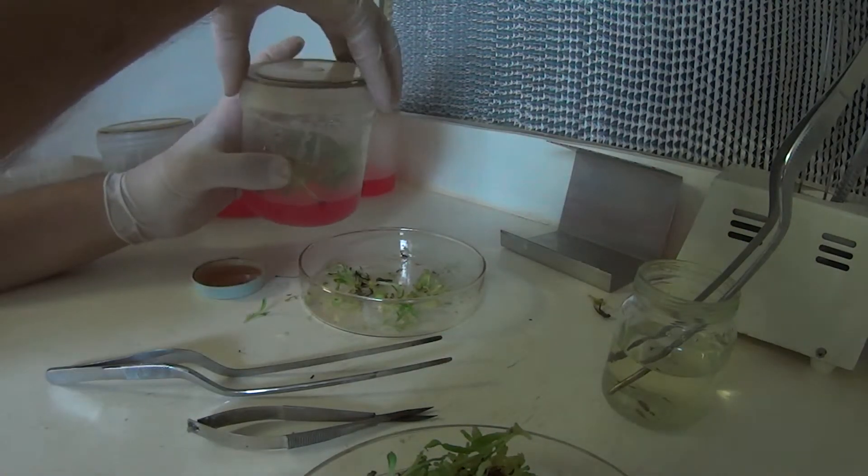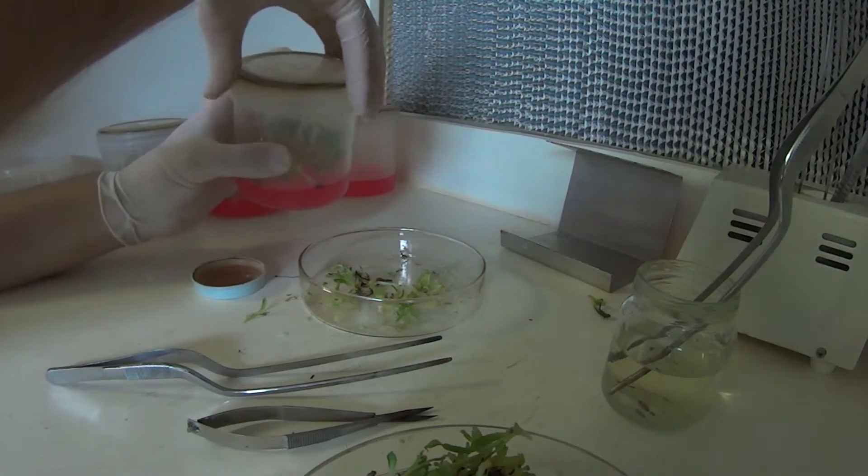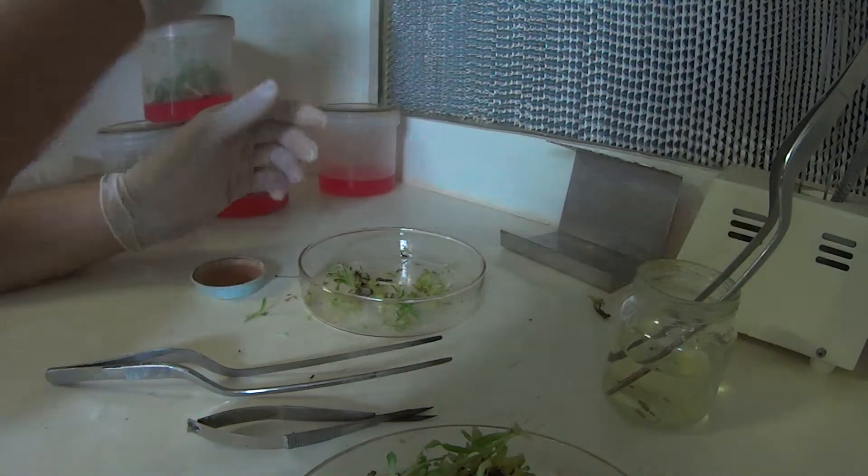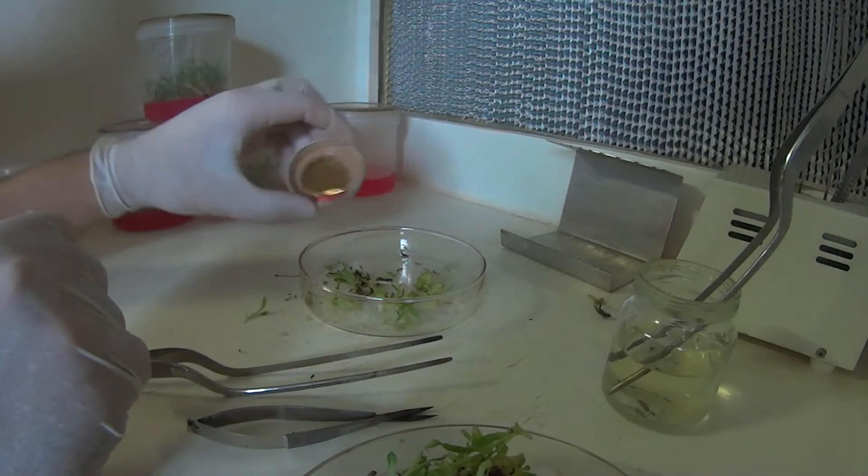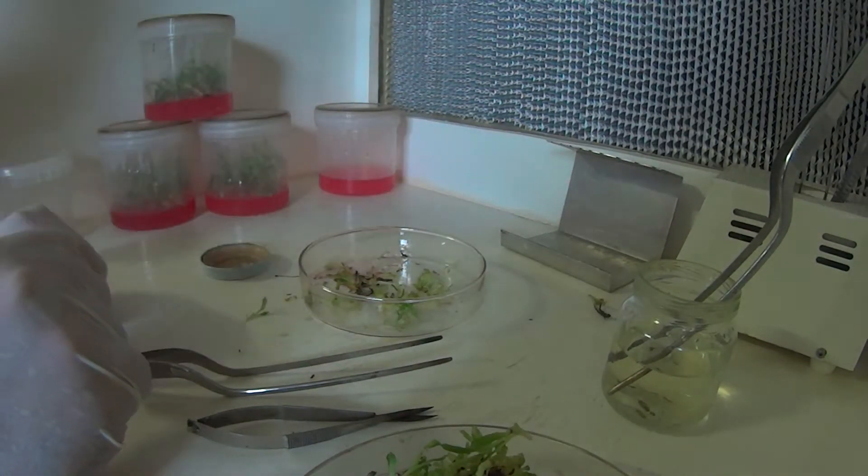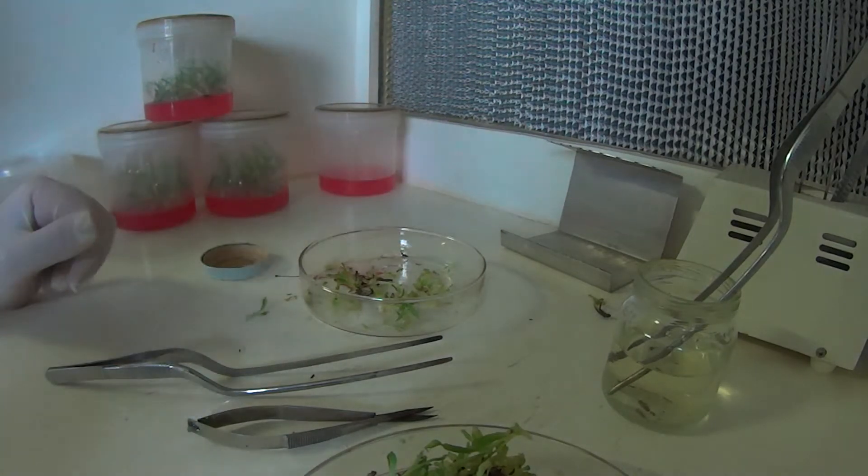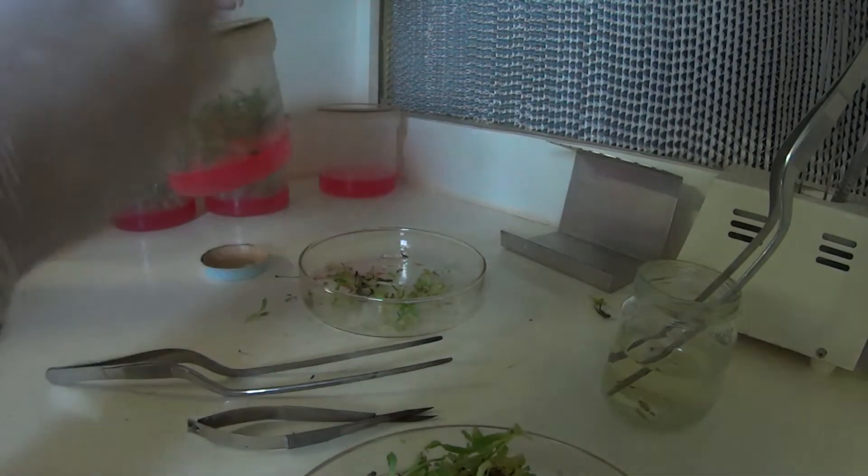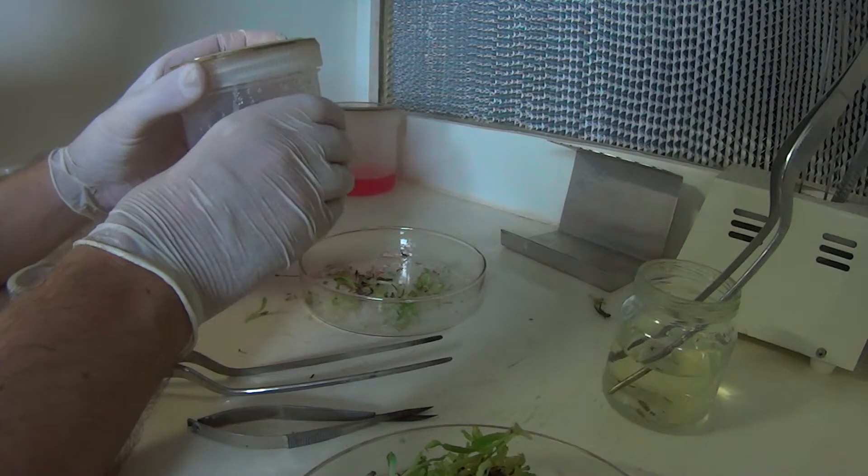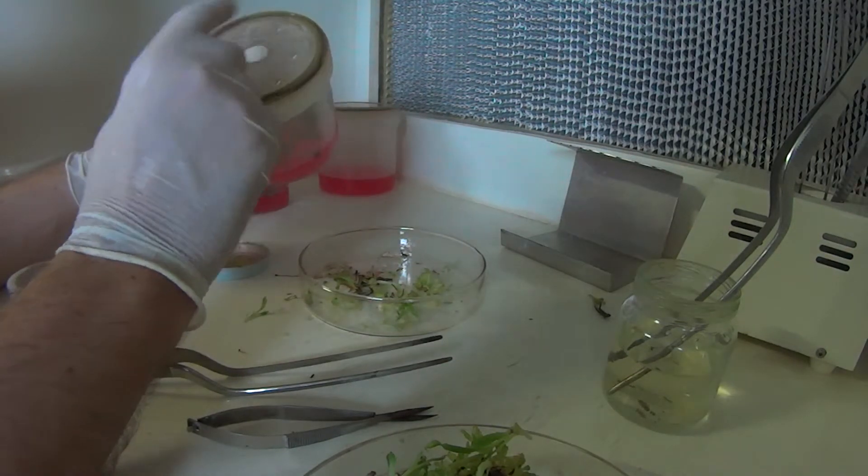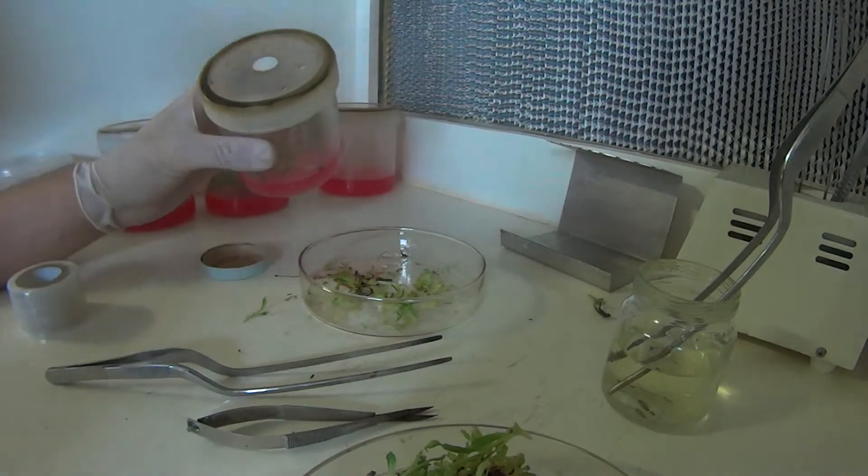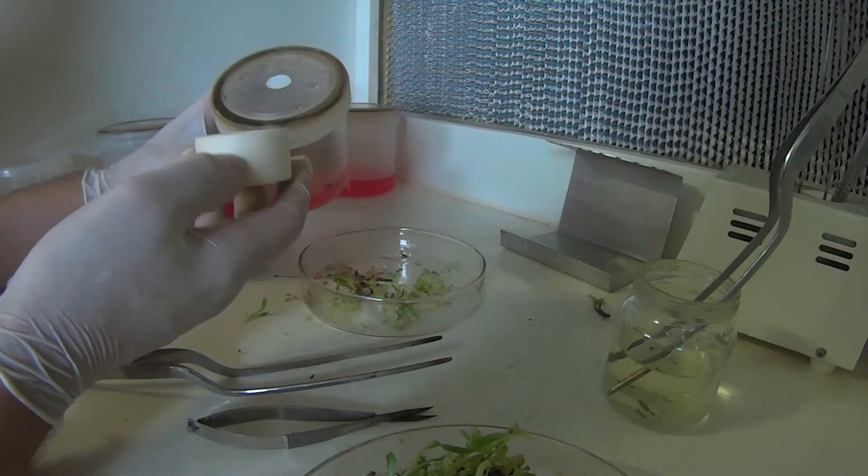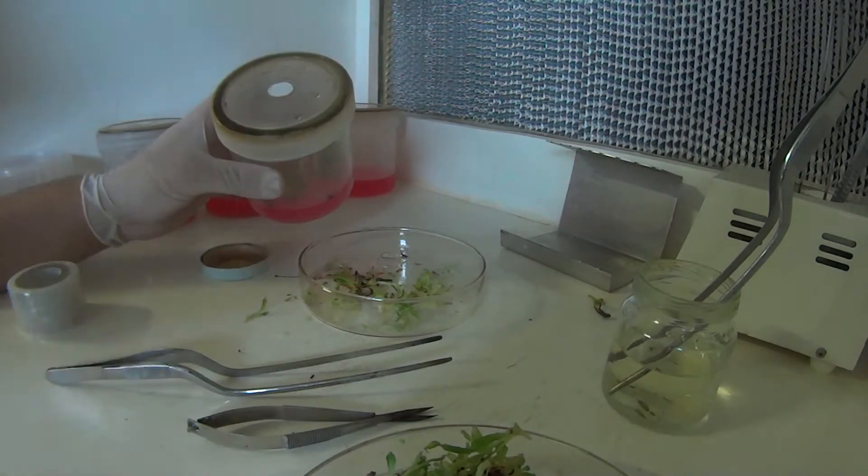We could probably save a few more plants there but really there's probably 30 or 40 plants there, enough to deal with at the moment. Like I said these have got the vent spots in them. The other containers I used earlier had my homemade type of vent spot with just the 3M micropore tape across the top of them.